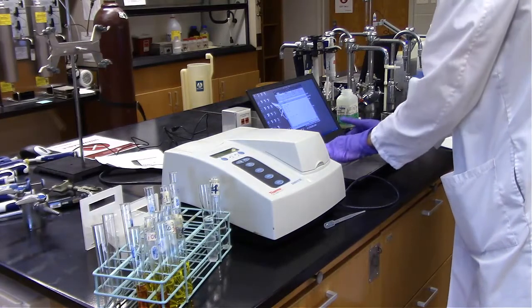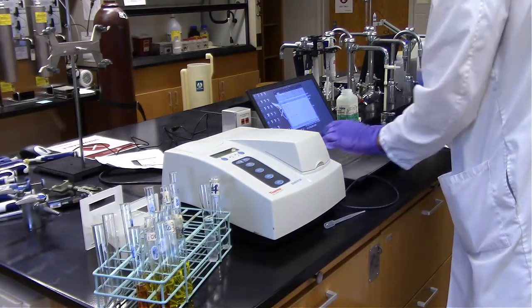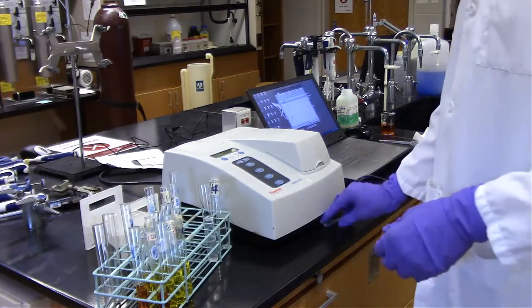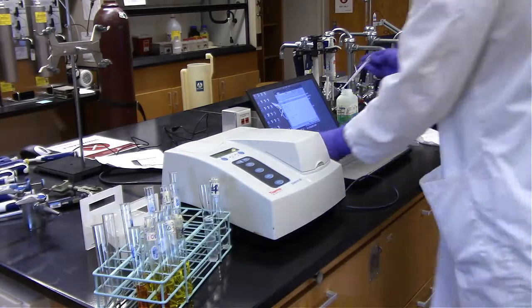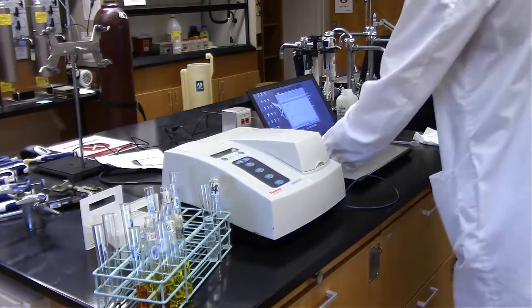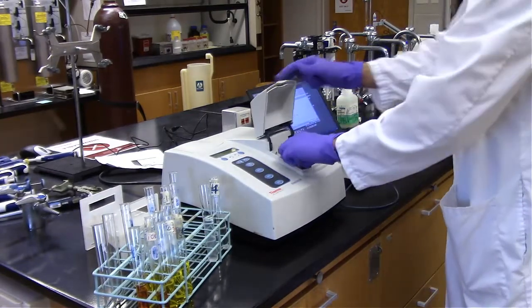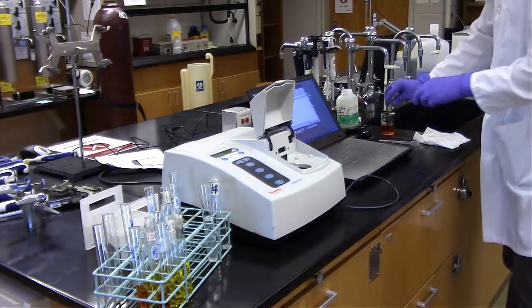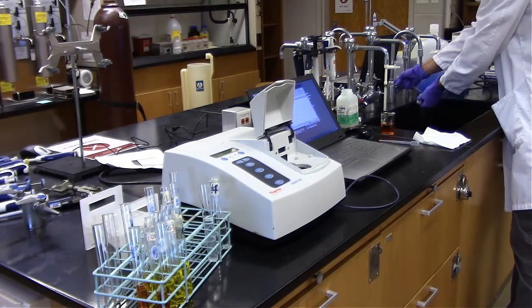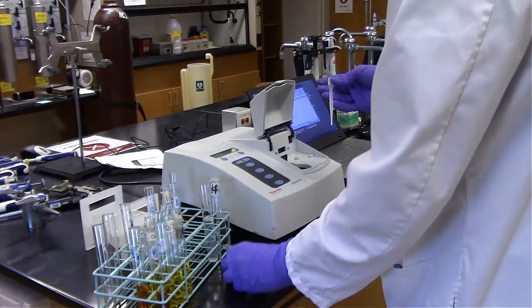And again, the absorbance shows up on the instrument, so I'm just entering that value into the computer right now. And you've probably seen this enough times, so each time I'm going to thoroughly rinse the cuvette. It was still wet for the first one. So I'm going to test each one twice, and then finally test the control.